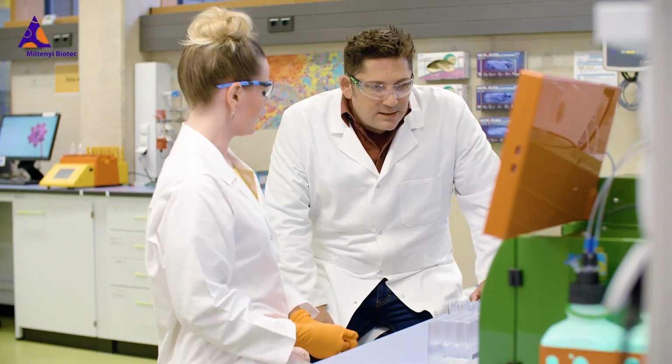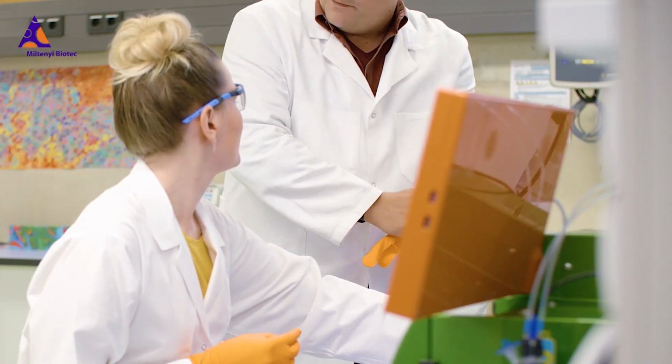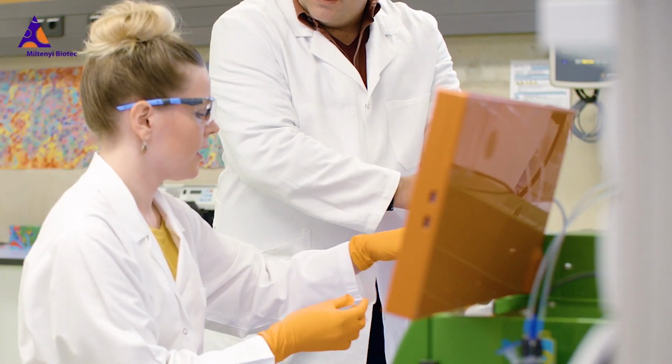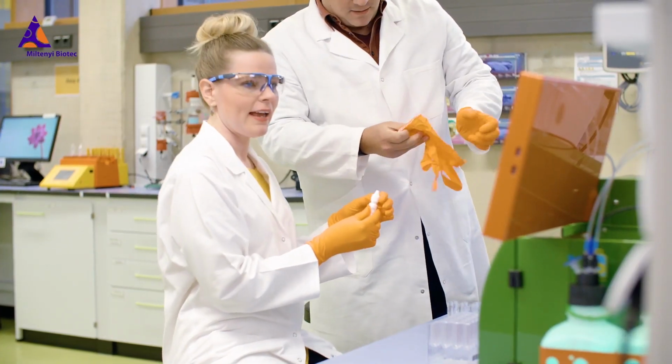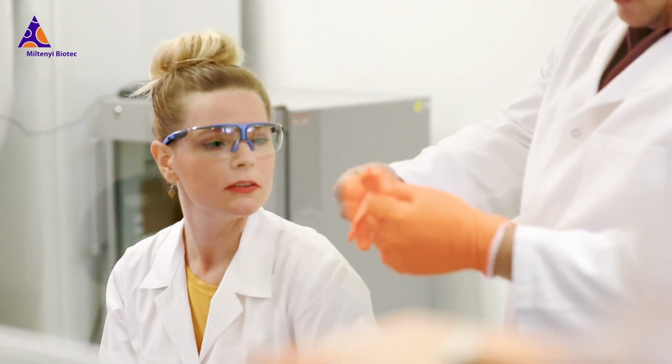Oh, yeah, so you got one of the assays in there, huh? Yes. It can be annoying if you haven't got it off. Have you had much experience with those? We've got you on the new machine, too, yeah? The quant. Yeah, but one machine's pretty much like the other, isn't it?